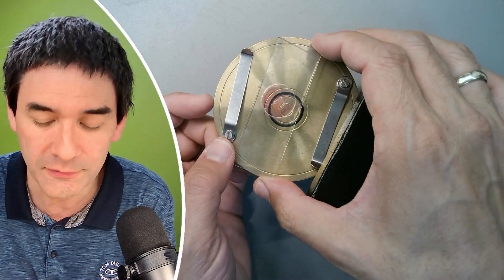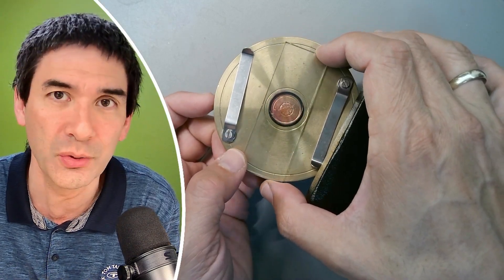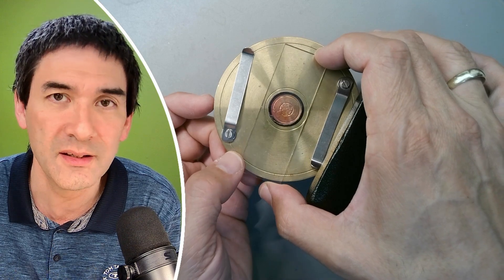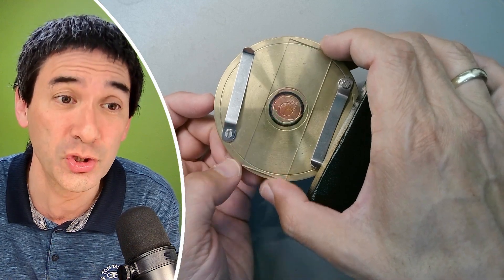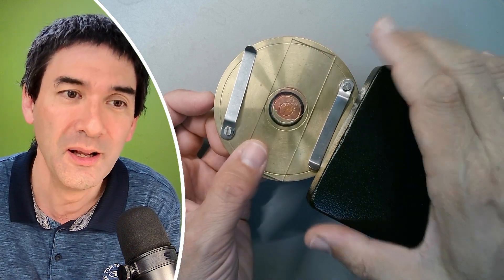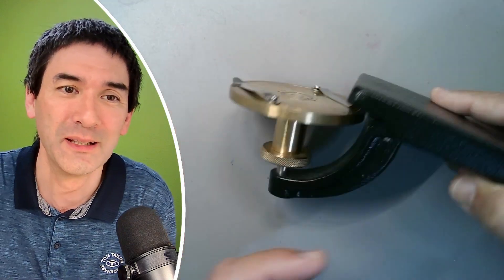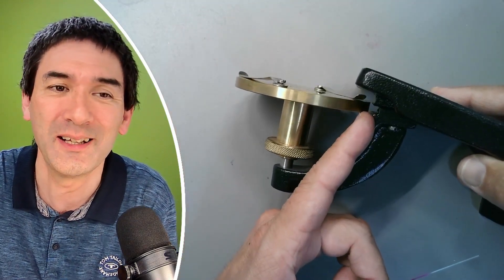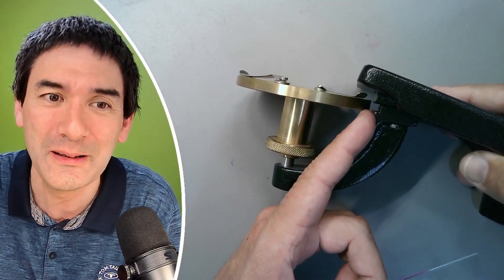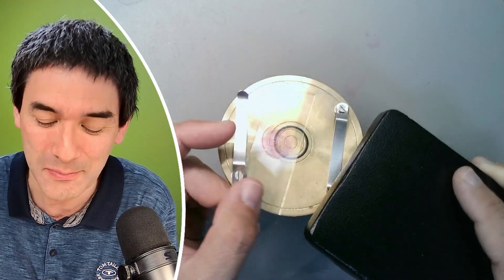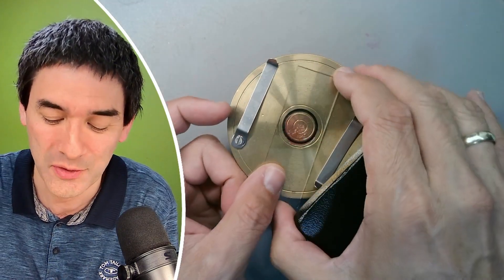So what I have to do is I have to make a different slide, and I'm also going to basically then put that slide then on here so it actually shows that when making one of those slide ringing tables, maybe give it a little bit more flexibility so that the slide, even if it's not completely centered, the cover glass, that you're still able to spin it. But right now it's not possible.